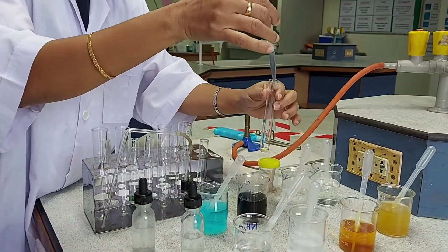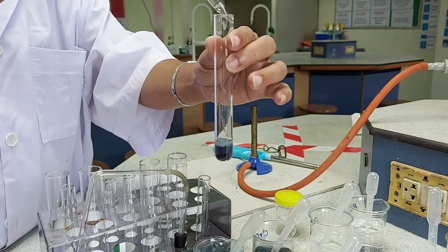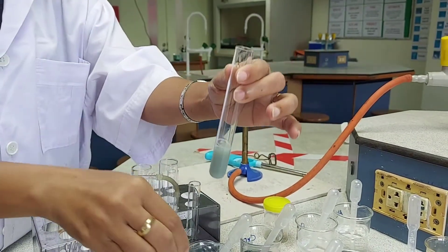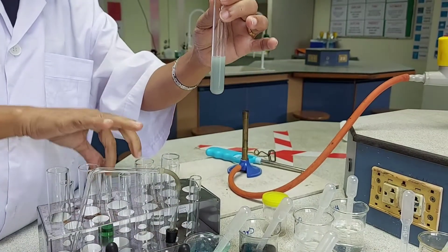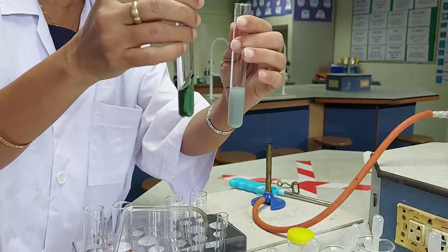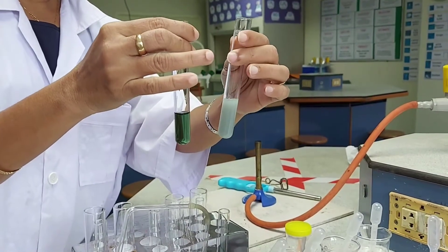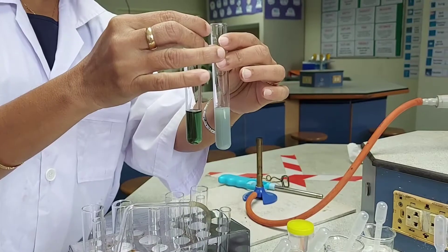I repeat this experiment with ammonium hydroxide, taking a few drops of ammonium hydroxide, and I get again a blue-green precipitate. Adding excess ammonia, the precipitate is insoluble in excess ammonia — the precipitate remains. So comparing the two: with sodium hydroxide, the precipitate dissolves in excess to give a clear green solution, whereas with ammonium hydroxide the precipitate does not dissolve. We can conclude that the given ion in the solution is chromium — Cr³⁺.